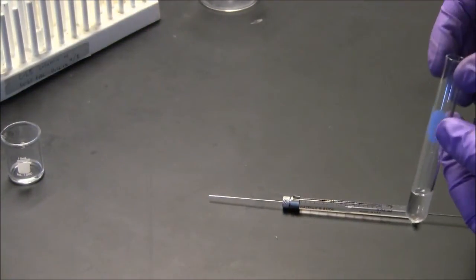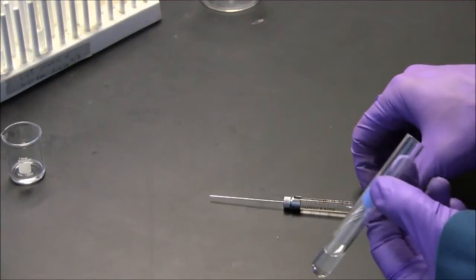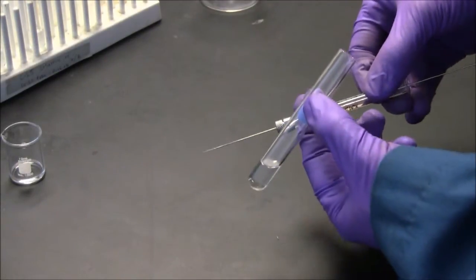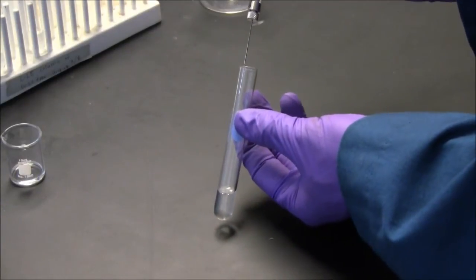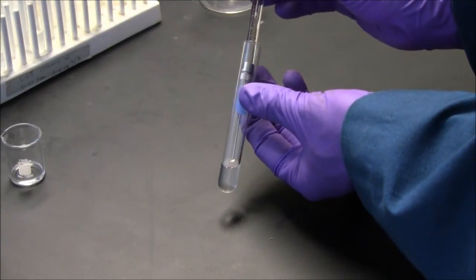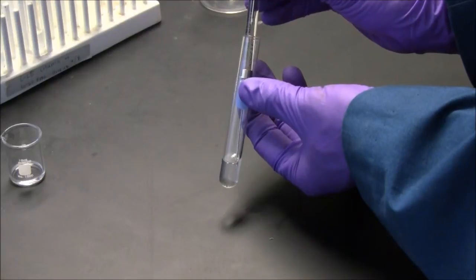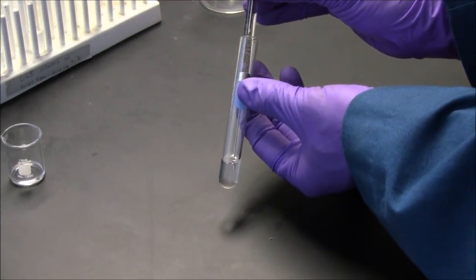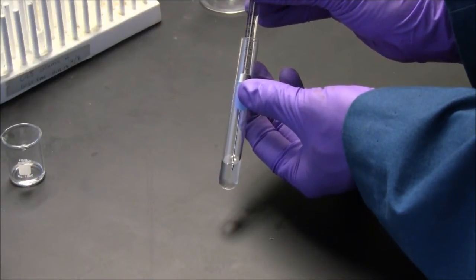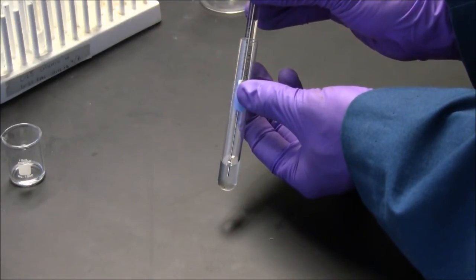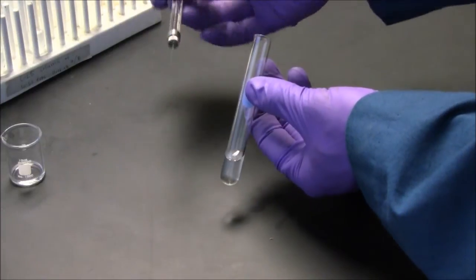Typically if you've only measured 30 microliters in your syringe, you want to deliver that directly into a liquid to make a solution. So here you can see I immerse the syringe tip in the liquid. Now I'll push on the plunger and there's really nowhere else the liquid in the syringe can go but into this solution right here.